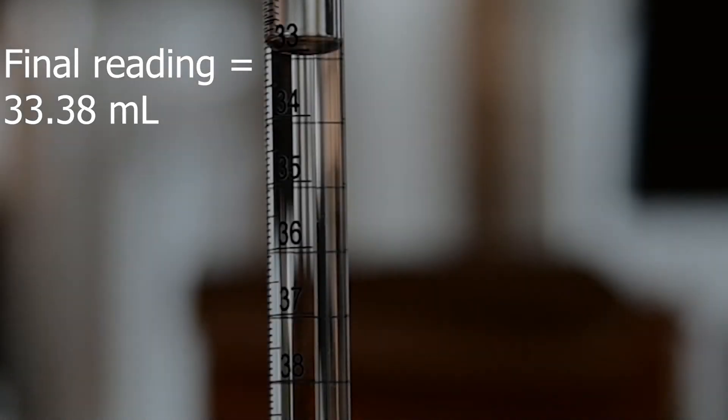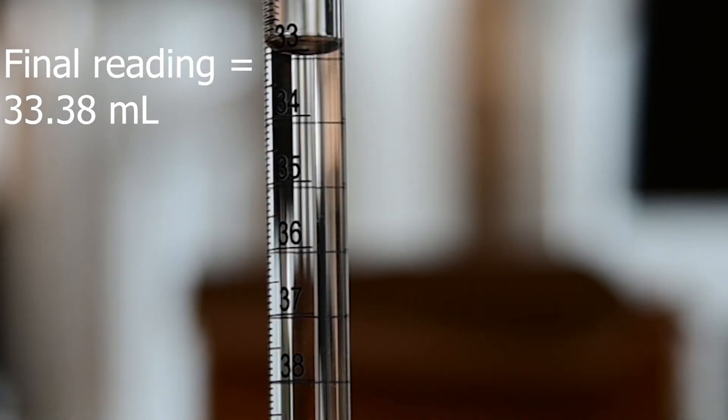Read the burette. I never squat down. I take the burette out. Hold it like this with two fingers and bring the burette up to my eye level and then read the burette. This is my final reading.